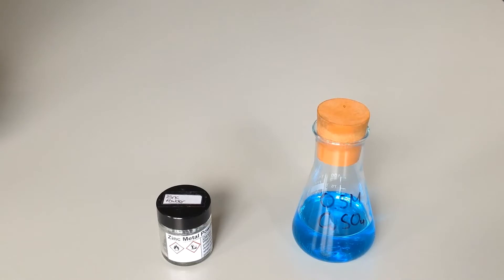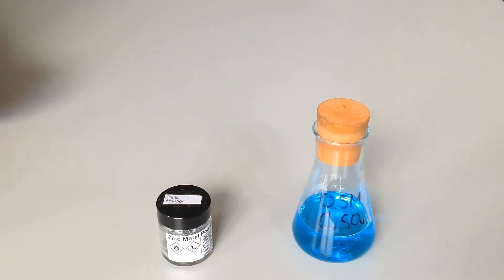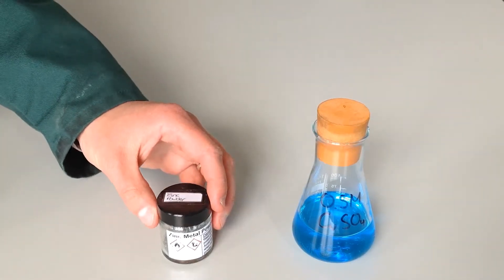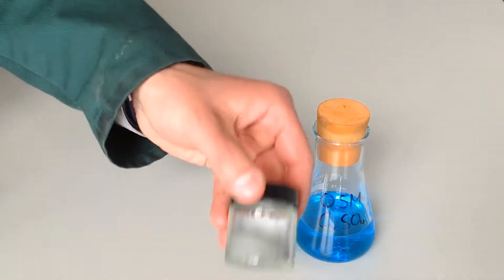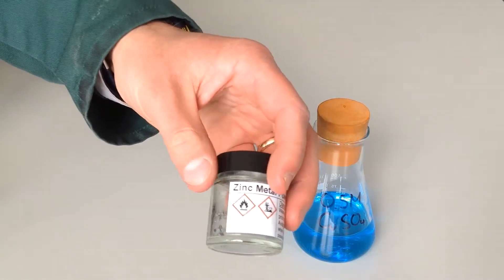Welcome to this video where we're going to measure the temperature change in the reaction between copper sulfate solution and zinc powder. As you can see from the zinc powder label, this grey powder is actually highly flammable, and so we need to be acting safely.